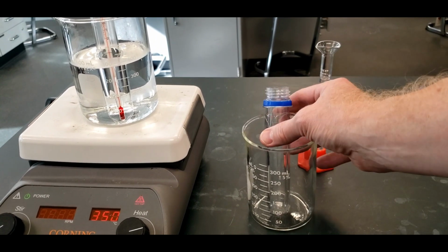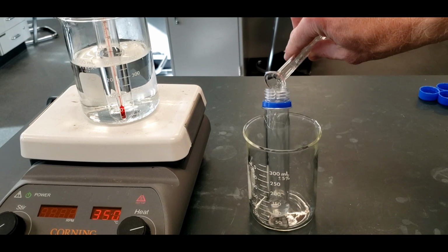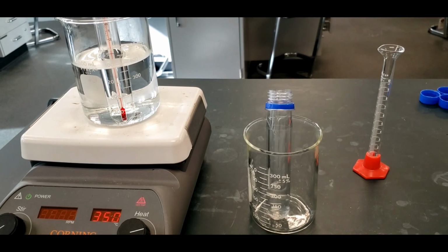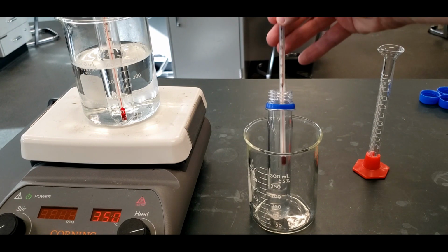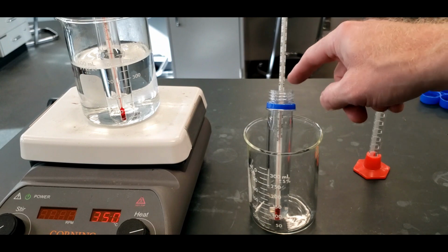Now we're going to take a plastic test tube, and we're going to put in 10 mils of water into this one. So this is at room temperature. We're going to add in a thermometer. And this is heating up. It's at 40 degrees Celsius. So when this gets to around 60, let's say it goes to 62, I'm going to write down 62, and then take this test tube and pour the water into here.